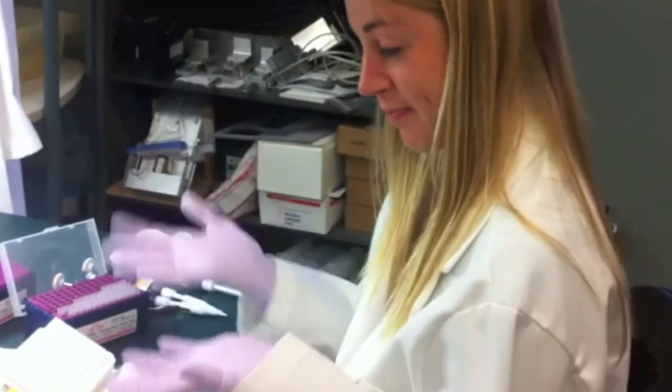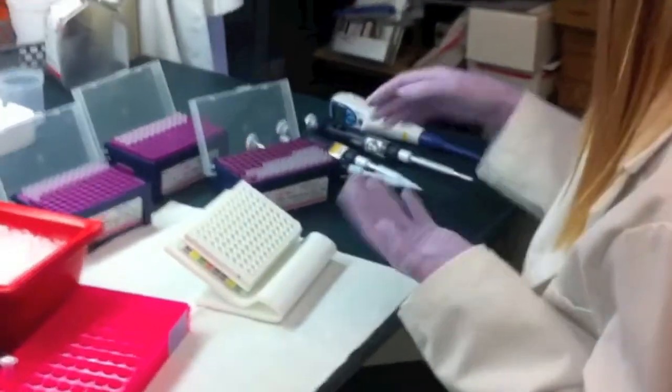Hi, this is Emma, the undergrad, and today she's going to show you how to set up a 96-well plate for PCR reactions.